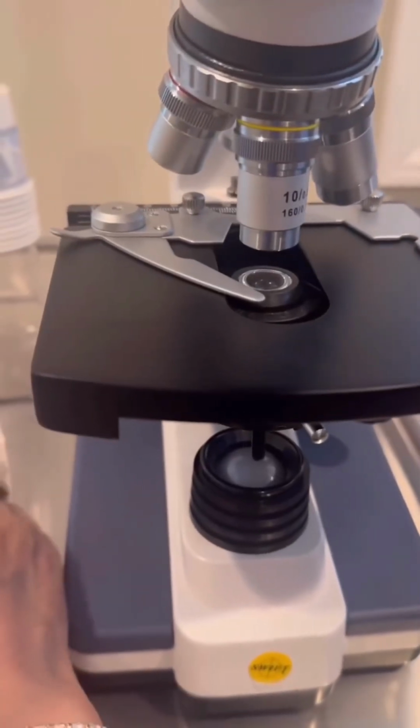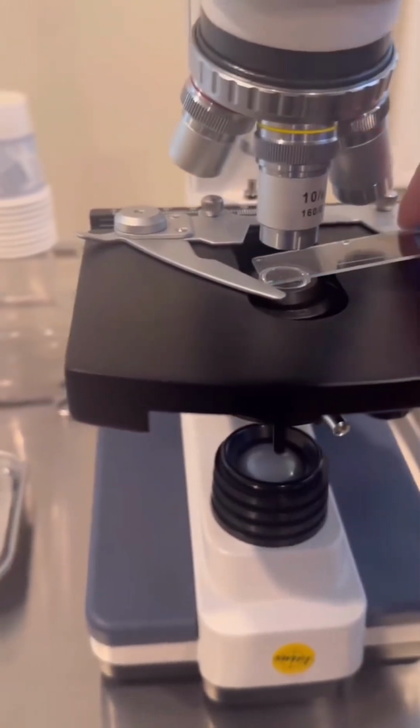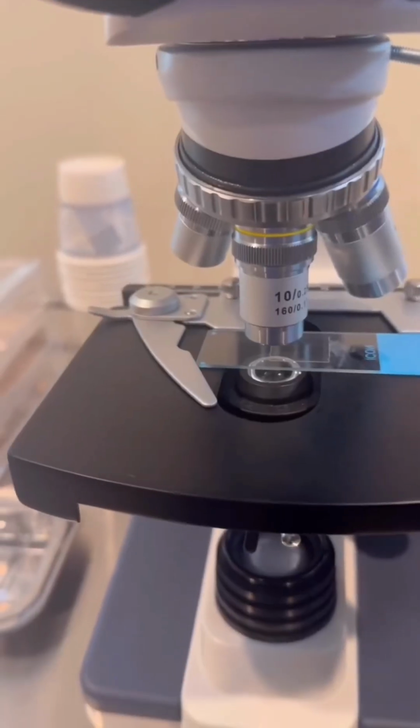Hello everybody, I'm back again today to show you what I found under my microscope. So let's take a look.